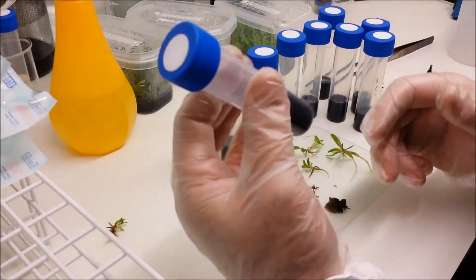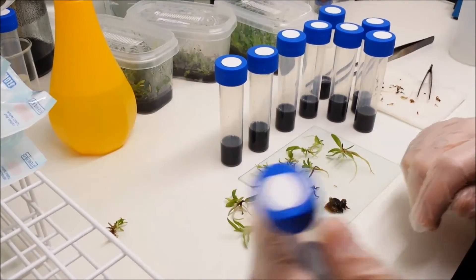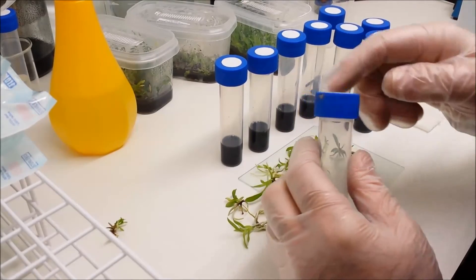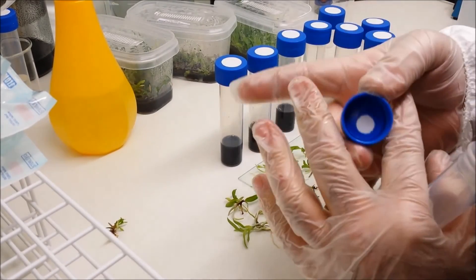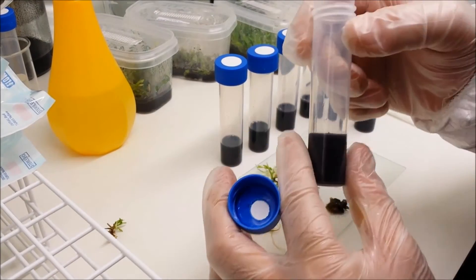All of the flasklets that we offer come in packs of three and they're all fitted with a point two of a micron filter on the top.